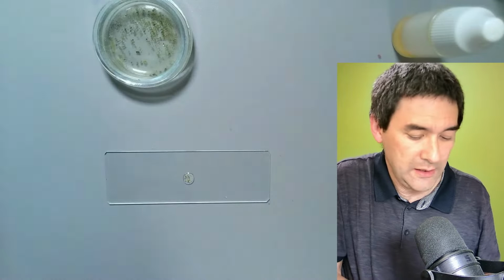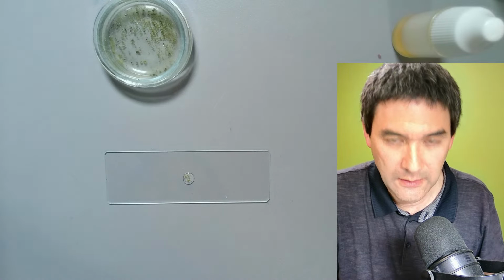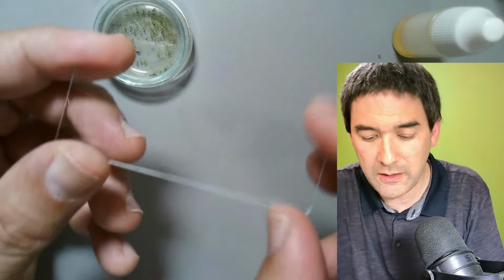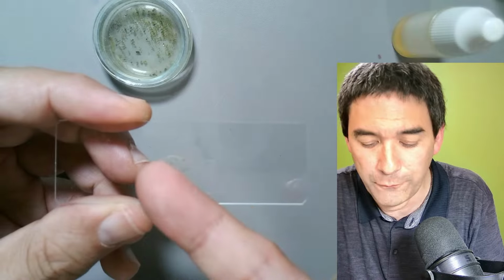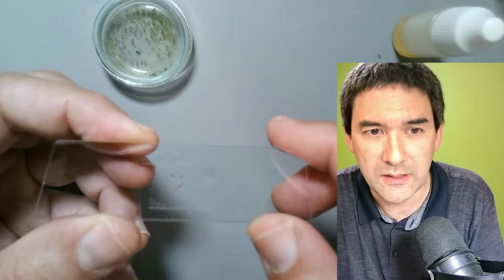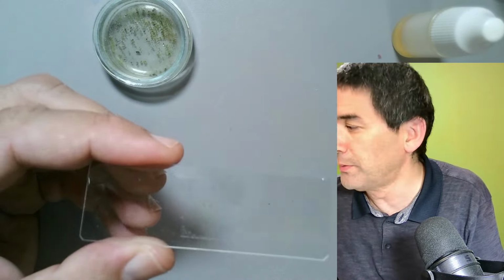liquid, then a cover glass, as always. And what I usually do is, when you look at it, it's difficult to see, but it doesn't even fully spread beneath the whole cover glass. And you see that it's pretty stable. So we're just going to do some regular microscopy using this here.